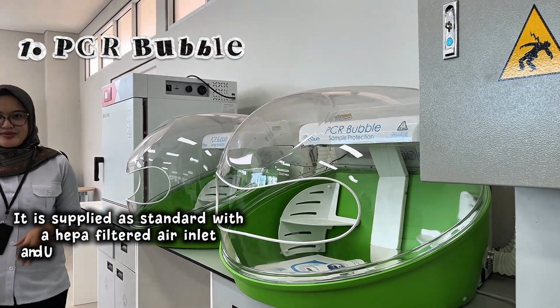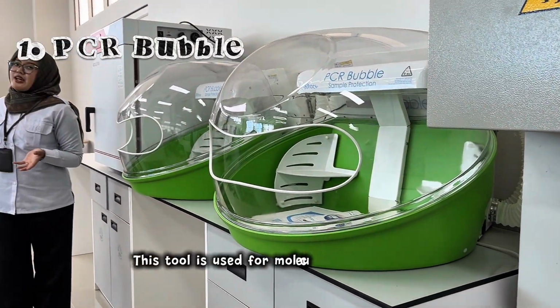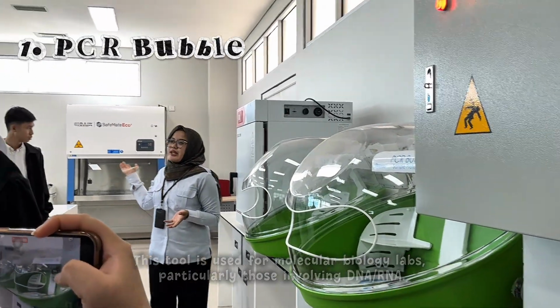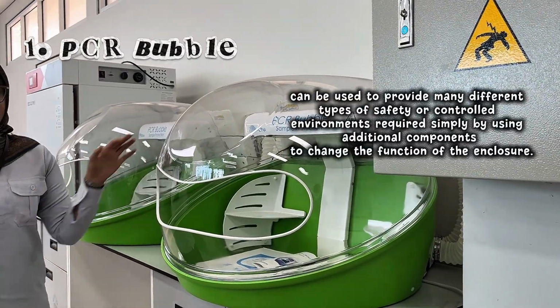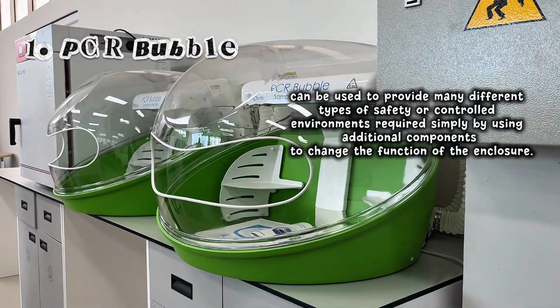It is supplied as standard with a HEPA-filtered air inlet and UV decontamination lamp. This tool is used for molecular biology labs, particularly those involving DNA or RNA. It can be used to provide many different types of safety or controlled environments simply by using additional components to change the function of the enclosure.